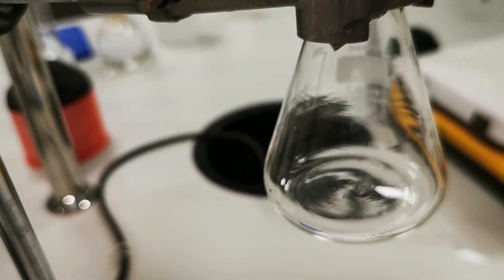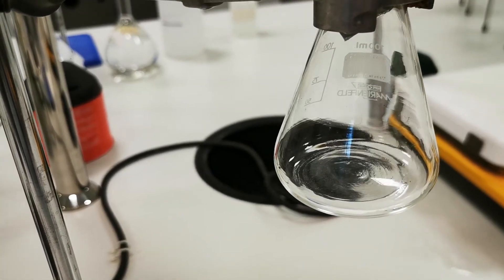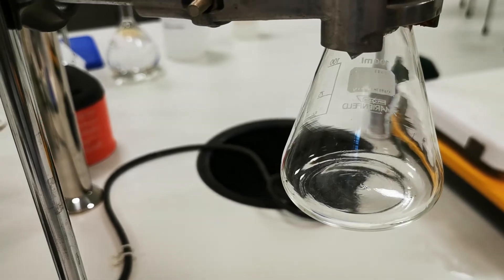If I bend it here, it shows clearly. So, before it condenses all, I'm going to go and measure the mass of the flask.